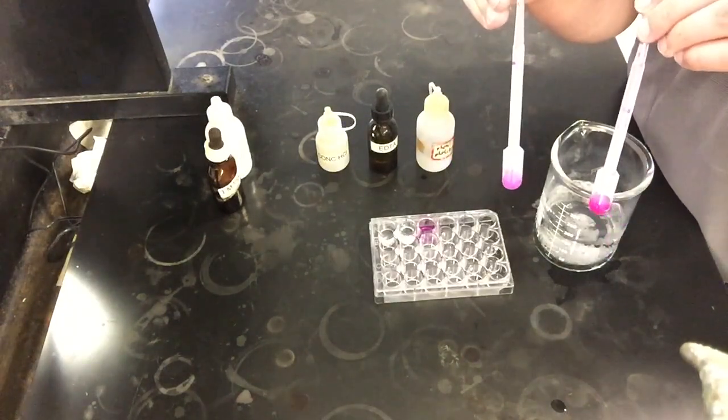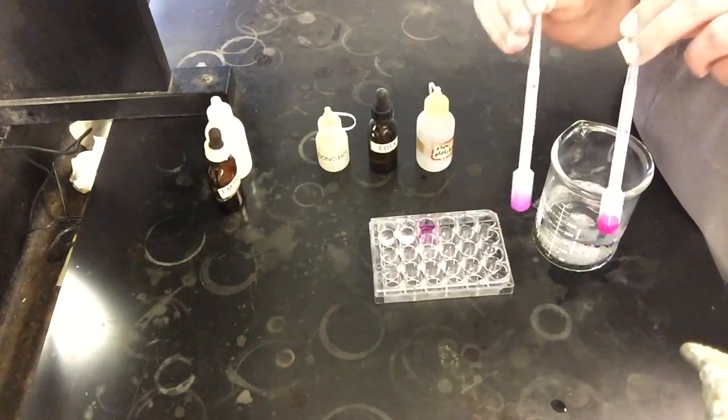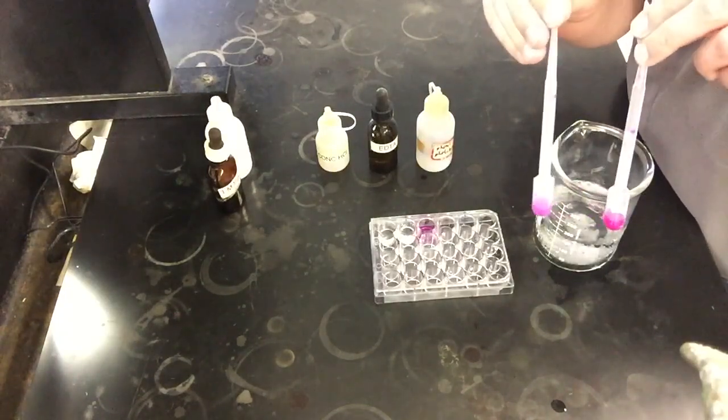You can go and piece that part together yourself to help figure out if things are exothermic or endothermic. But that's all the demonstration part for the second part. We'll move on to the third reaction now and show you the last little bits, and then we'll have a little bit of a wrap up.